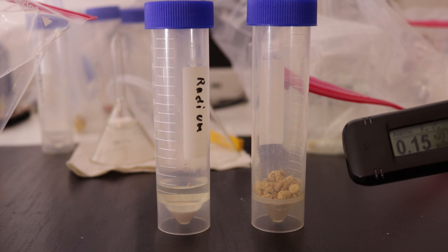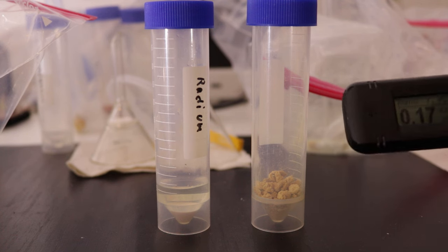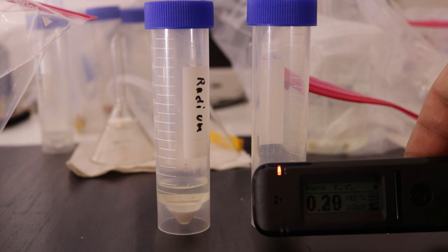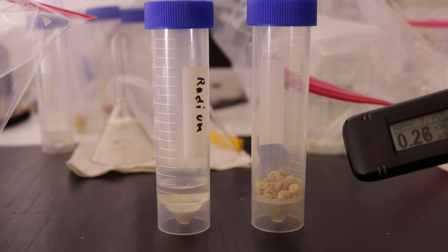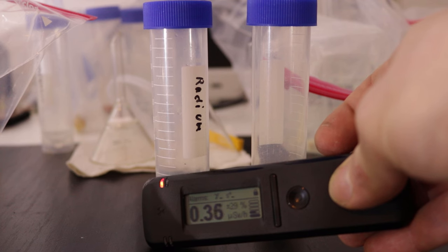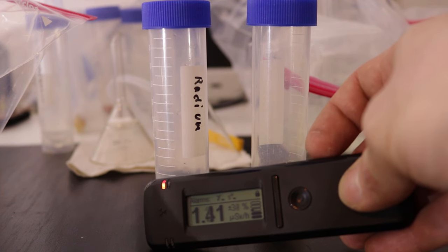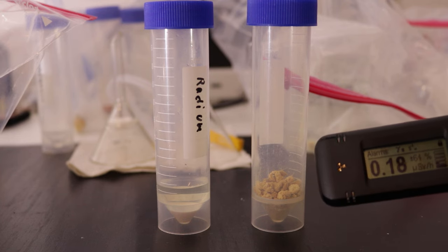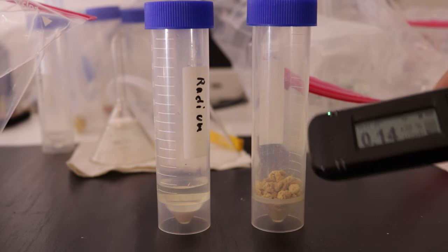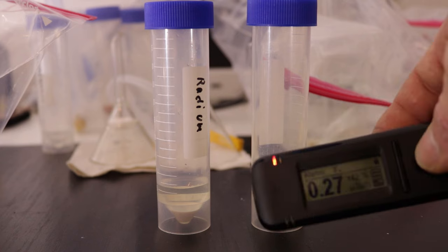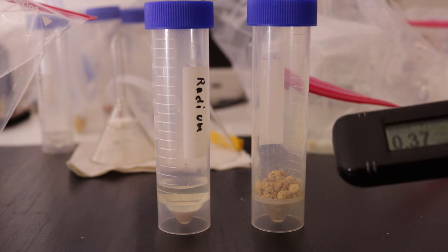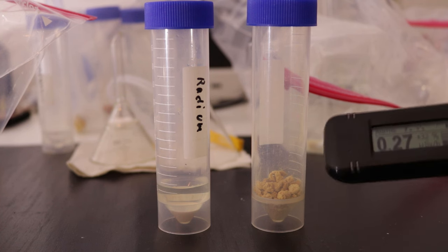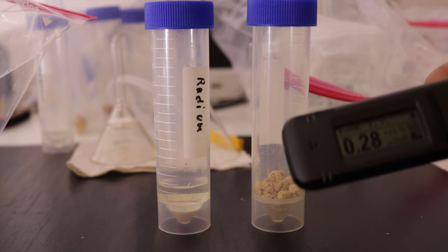I said this device is not sensitive to the radiation that's coming off of the uranium, but if I hold it on here, the alarm goes off eventually. It's not that intense as the radium. If I hold this one here it's really going to climb. Yeah it's now very high. But this device actually is able to identify the isotopes. This thing is actually a gamma spectrometer. We can identify both the extracted uranium from this and the radium and see how clean it is in terms of how much radiation is coming off of this. So let's look at the spectrums I got and talk a bit more about this actually pretty incredible device.